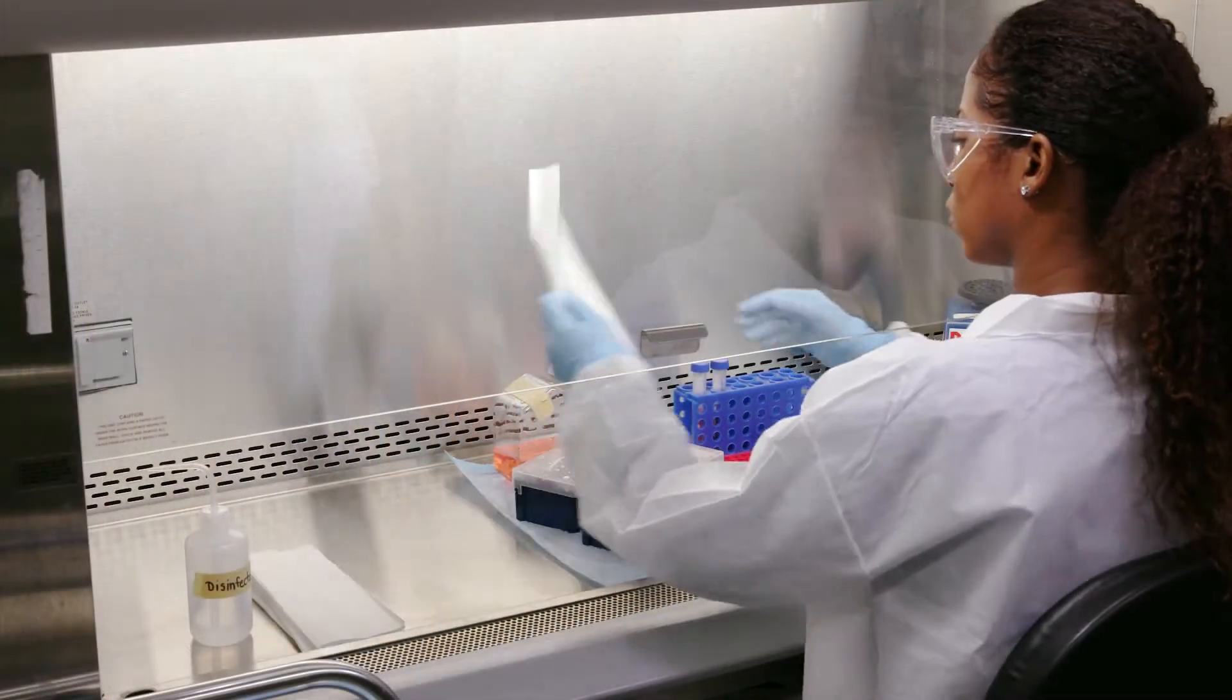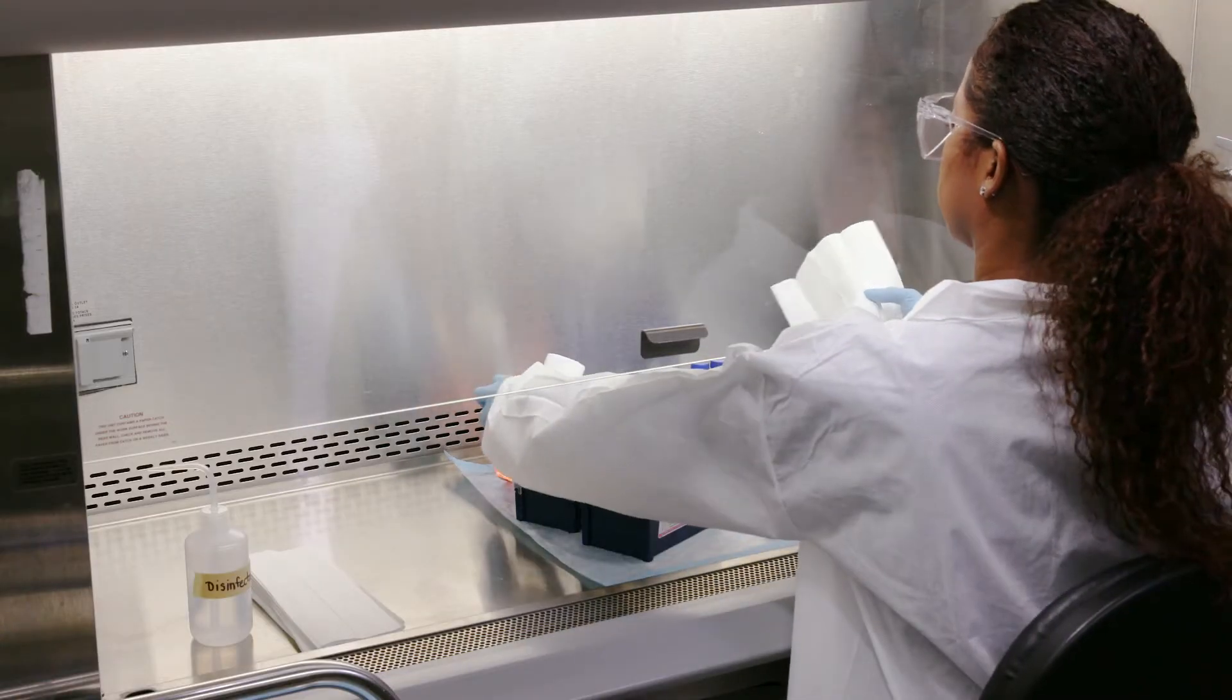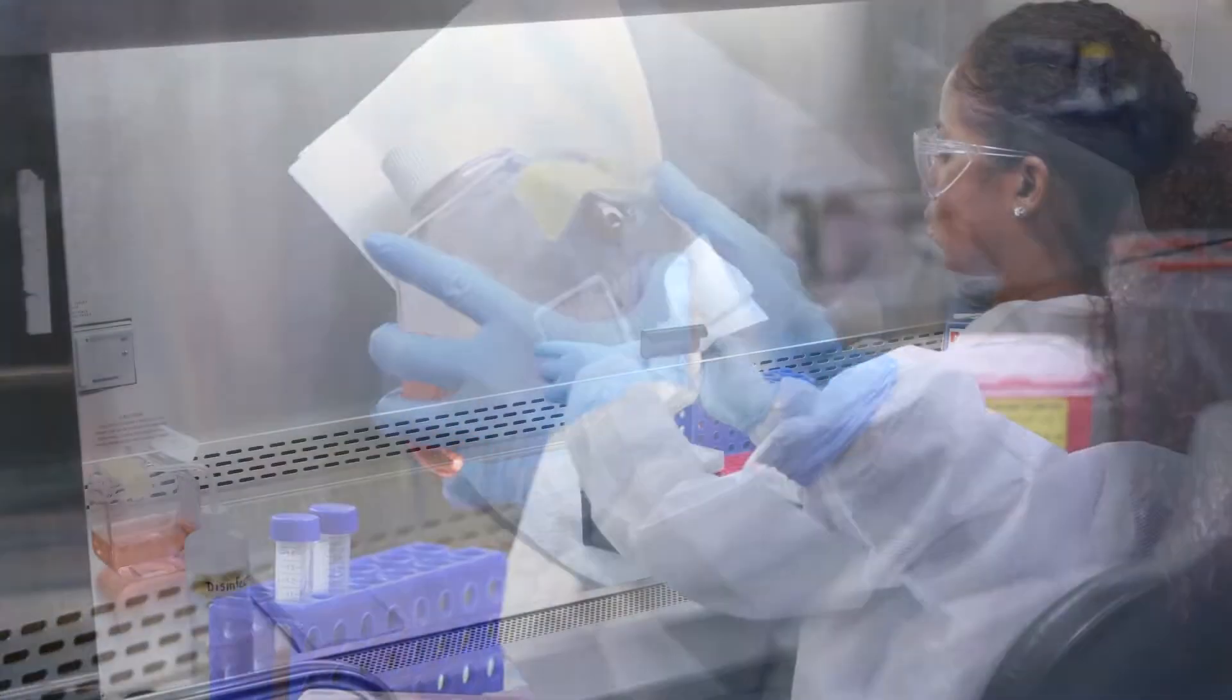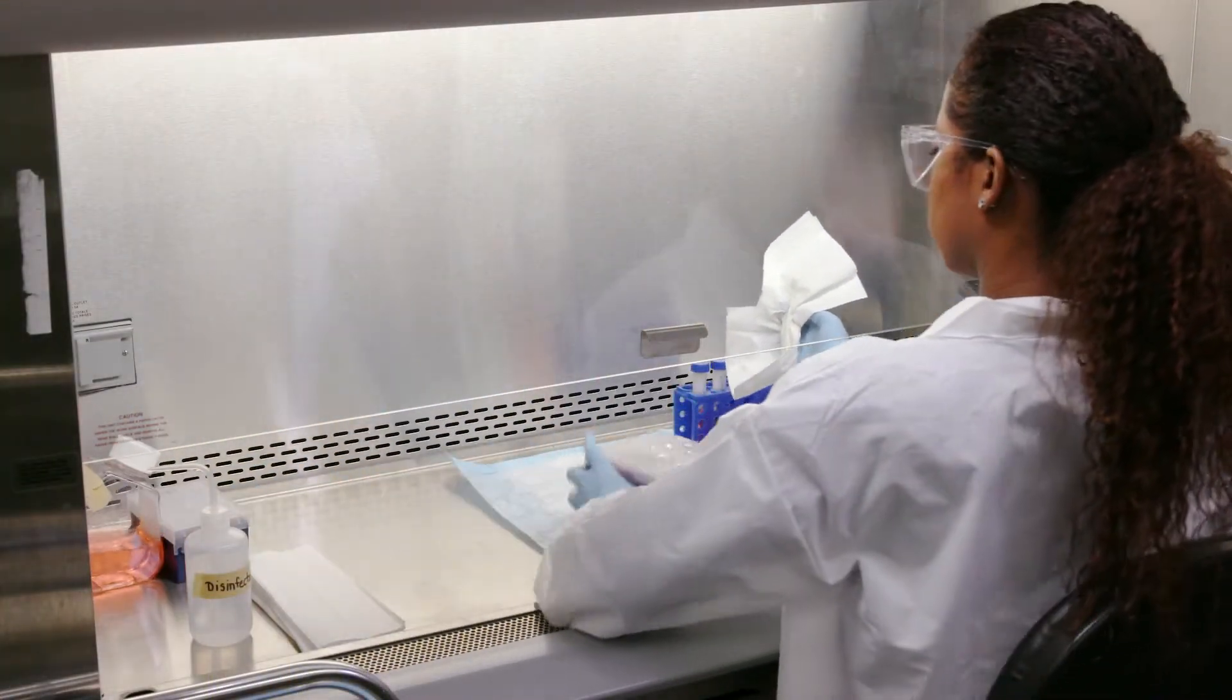After the appropriate contact time has passed, remove any residual wetness and place the materials that will remain in the cabinet on the designated clean side of the cabinet.